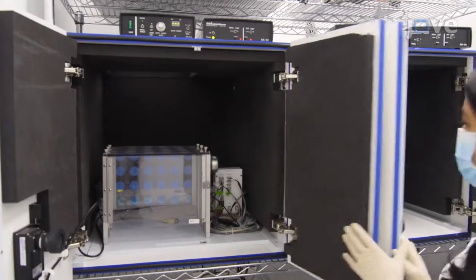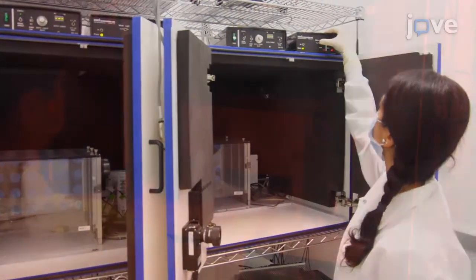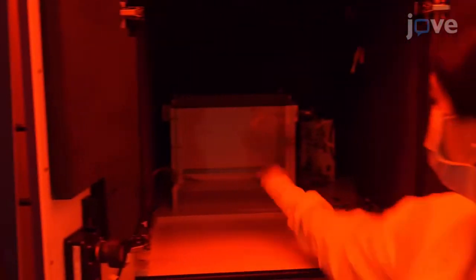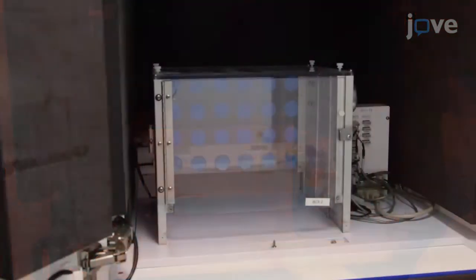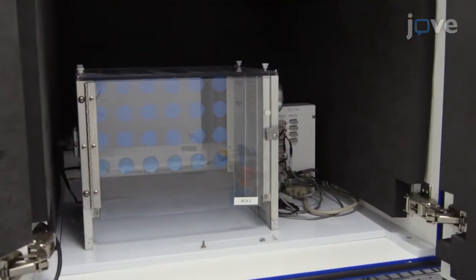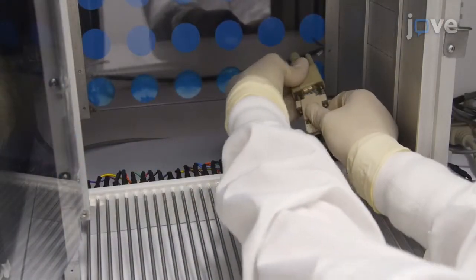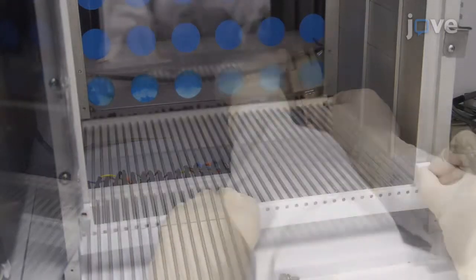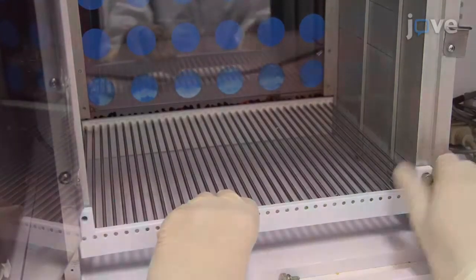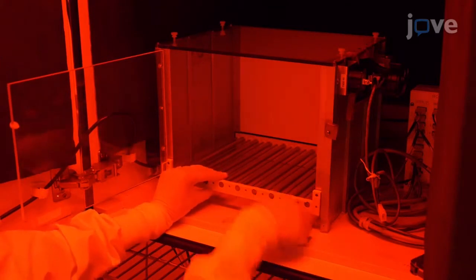Begin by setting up one set of fear conditioning chambers to serve as context A, and a second set of fear conditioning chambers to serve as context B. Place each fear conditioning chamber inside a sound attenuating cubicle to prevent intrusion of outside noise. Then place grid floors in each fear conditioning chamber for foot shock delivery, using a different grid pattern for each context to differentiate floor texture between contexts.